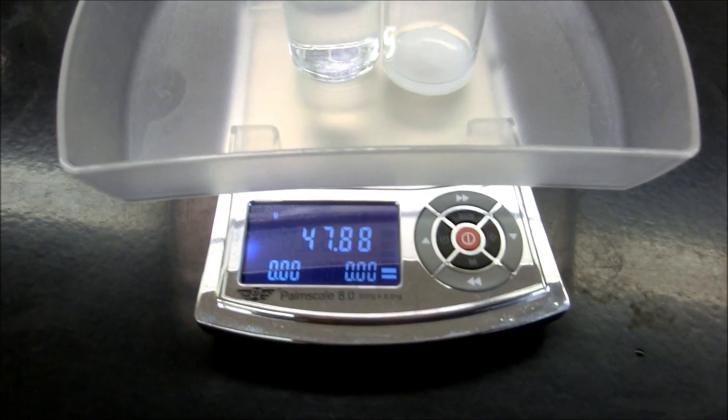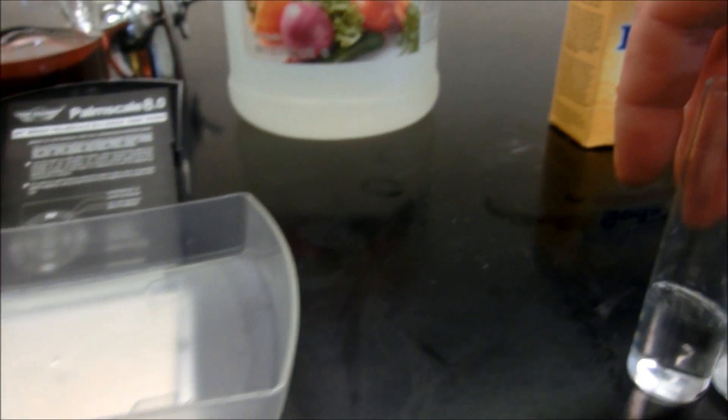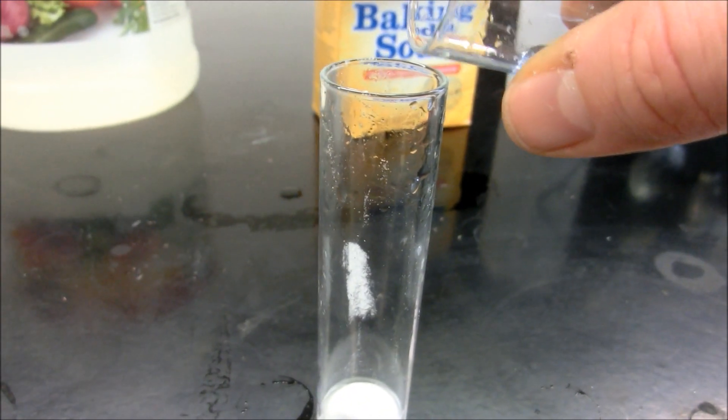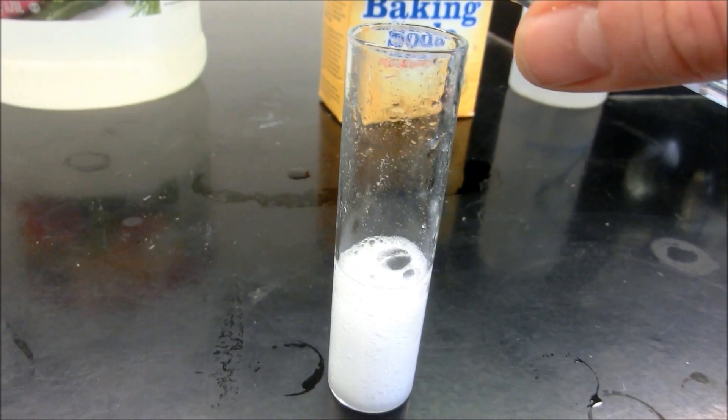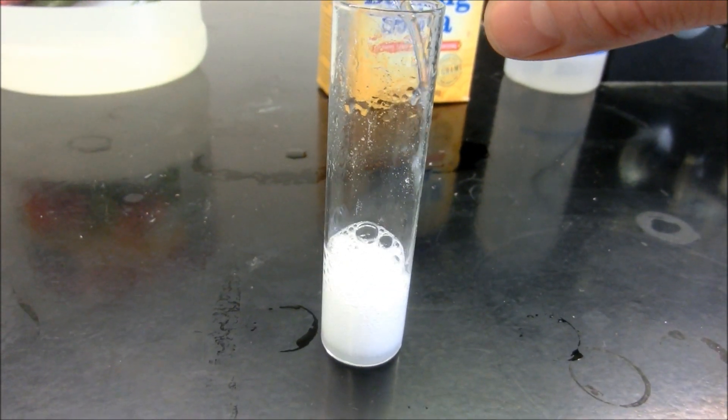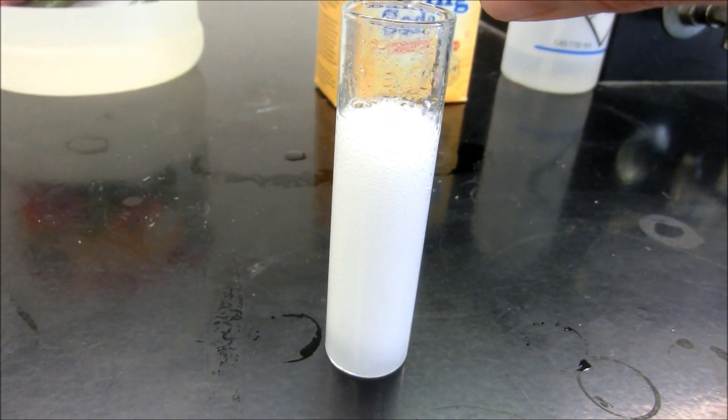The mass of those two together, 47.88 grams. Pulling that off. And let's go ahead and pour the vinegar carefully into the tube. And then hopefully it will not overflow. Yay!